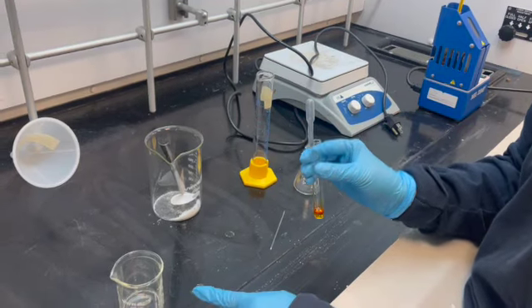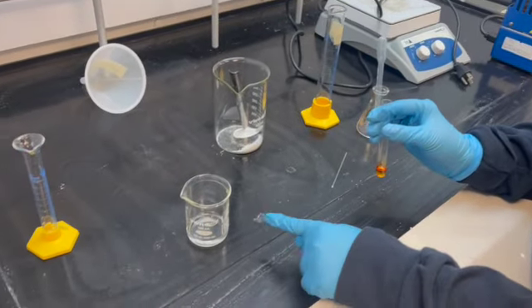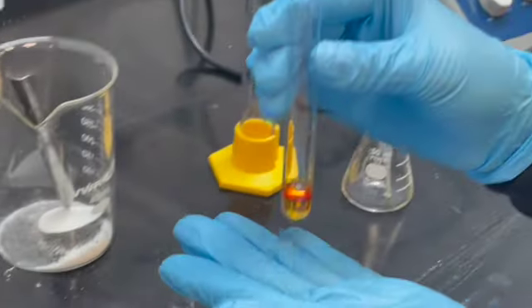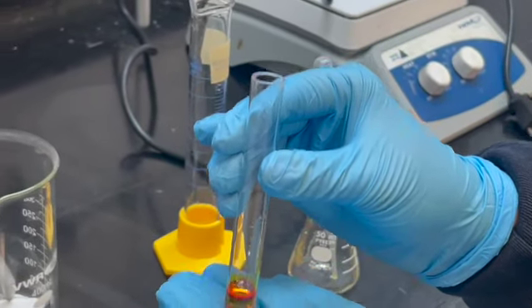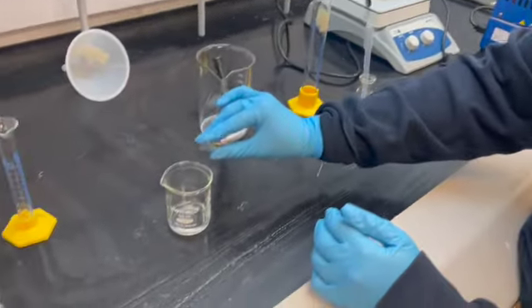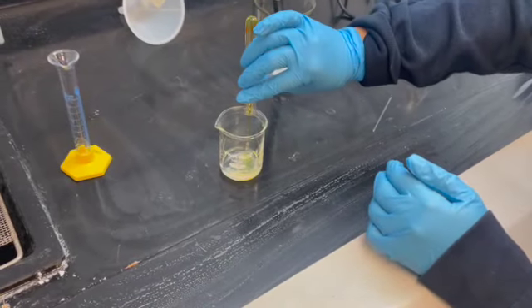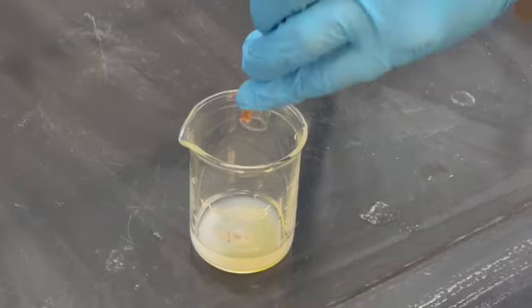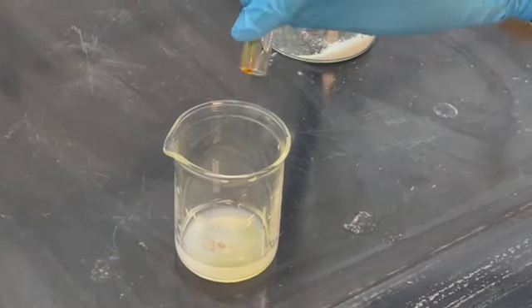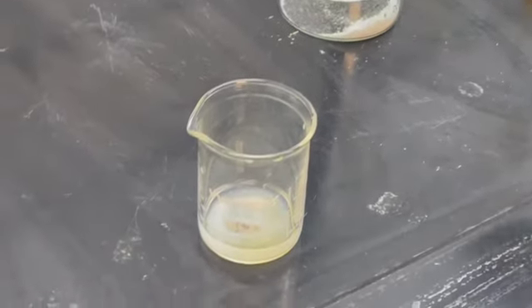We have a pre-measured beaker with 10 milliliters of deionized water, and we're going to add our solution with our solid and the H2SO4 into it. As we can see, it immediately condenses and turns into a white cloudy substance.